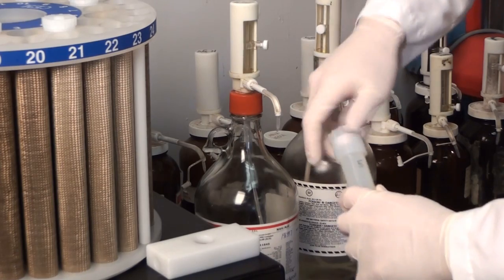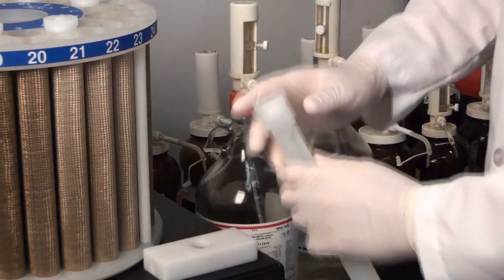Once the sample has been prepared, the technician will load the vessel into the microwave carousel.